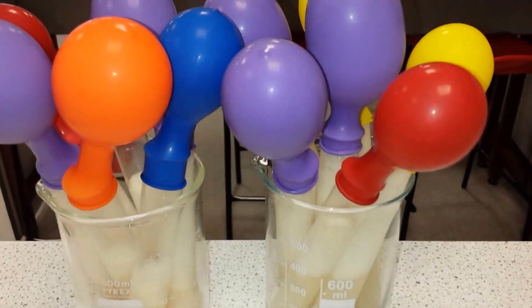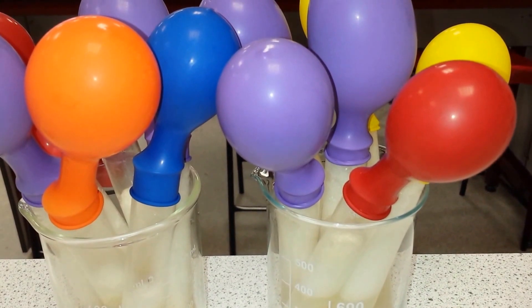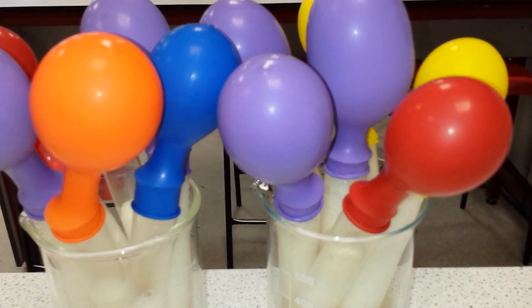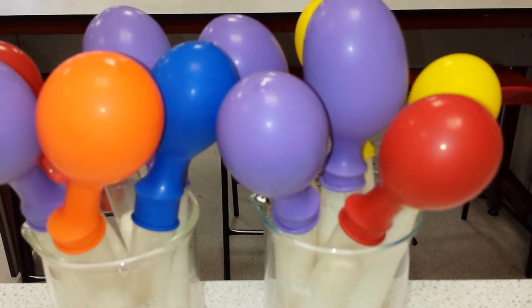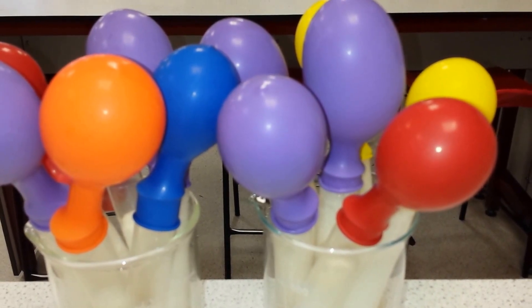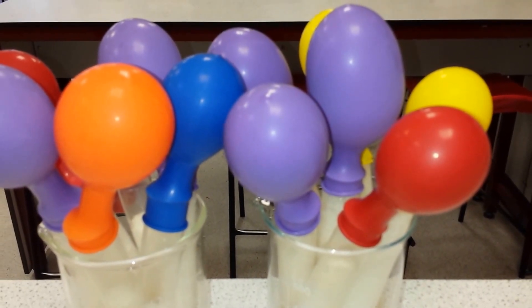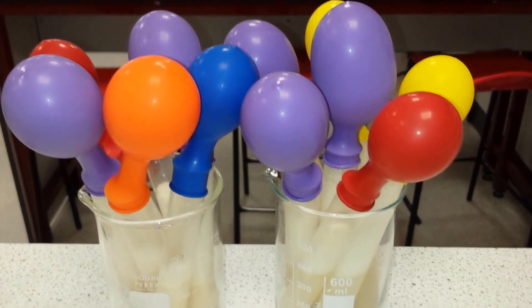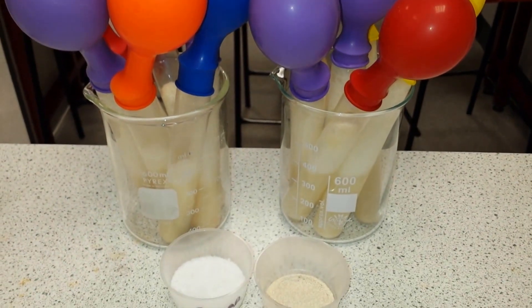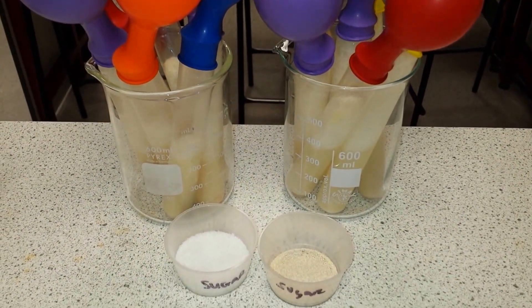You can see that if you place a balloon over the test tube, the gas is produced. We can then test to see what type of gas it is by using a lighted splint. If the gas puts out the lighted splint, we know the gas is carbon dioxide. We can also use a lime water test to see if carbon dioxide is given off by living organisms.